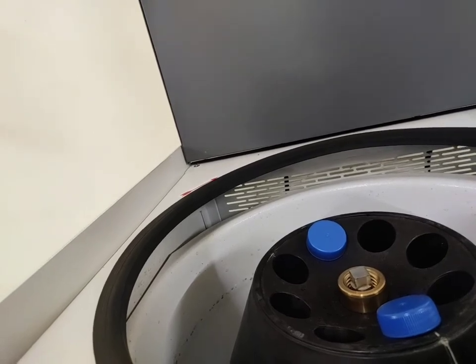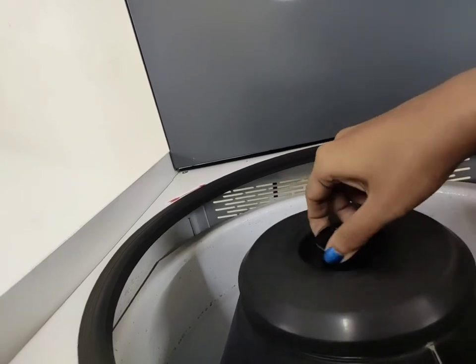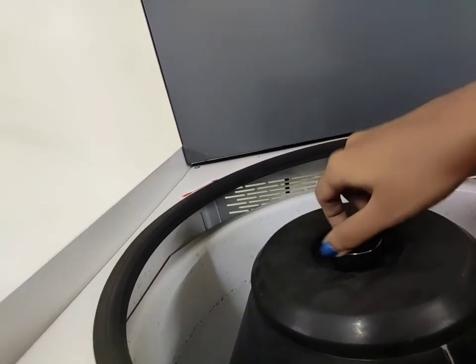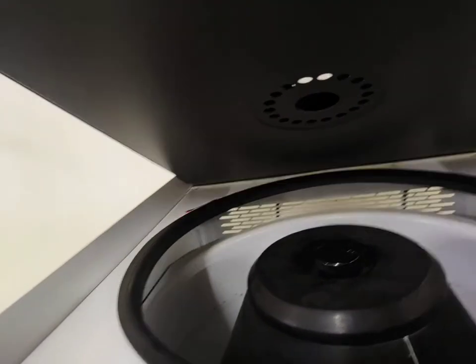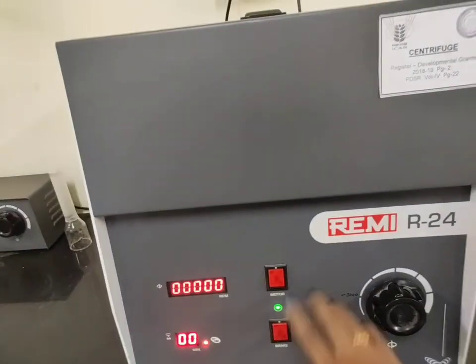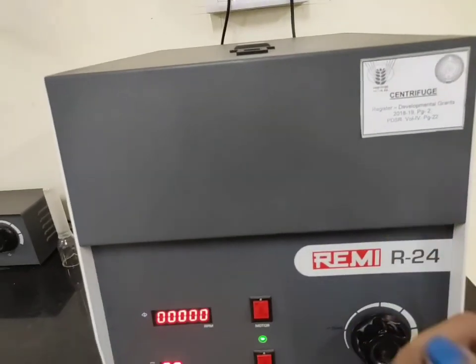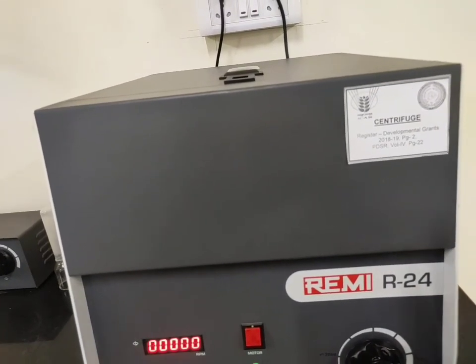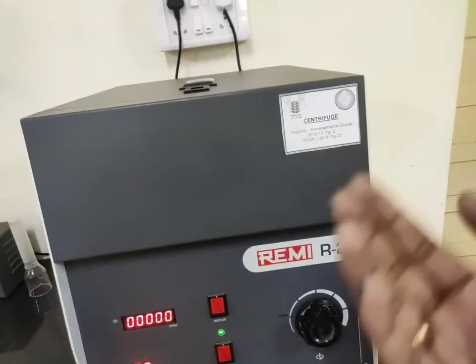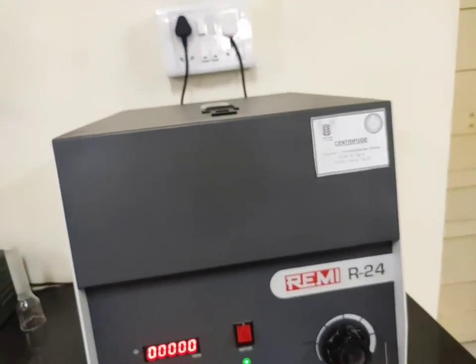Once you have kept the samples inside, close the rotor head lid so that when rotating at high speed the sample does not bump out. Then close the lid of the instrument. Since the rpm and time are already set, you just have to start the motor. Once you start the motor, the rotor will rotate at very high speed, and because of centrifugal force and the sedimentation principle, the sample with higher density will settle down while the solvent with the extract having lower density will float up.